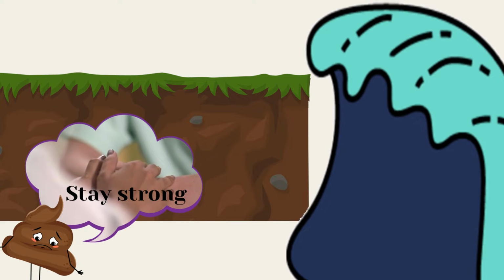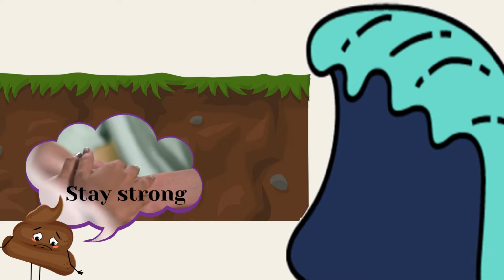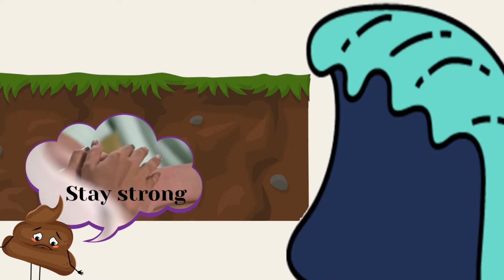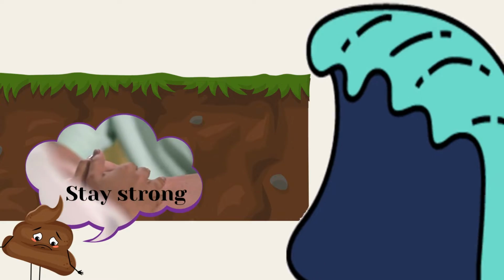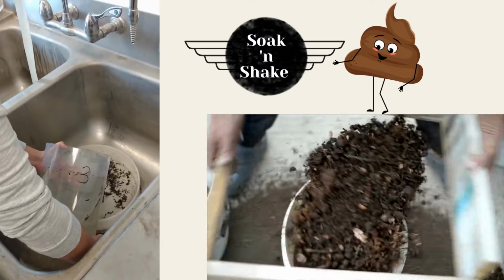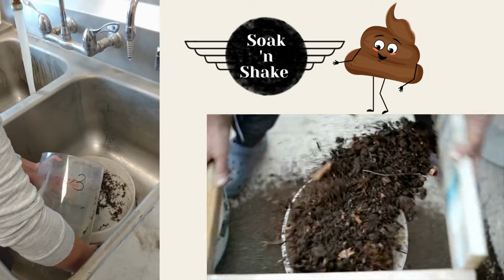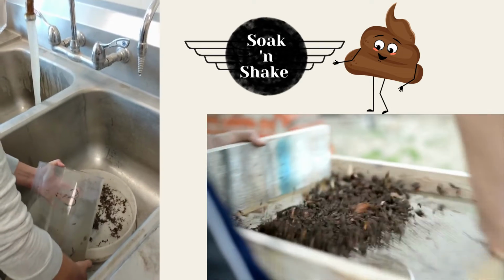So that's when soil is most vulnerable. Soil aggregates are most vulnerable when they're wet. So what we're going to do is test how stable the aggregates are, and we're going to do this by soaking our soil samples and then shaking that wet soil.